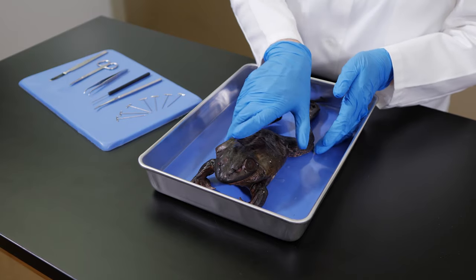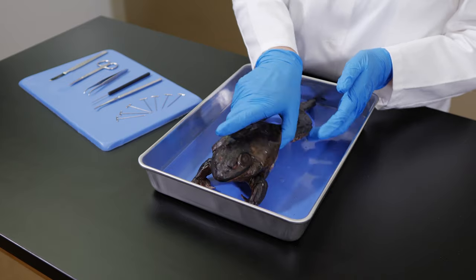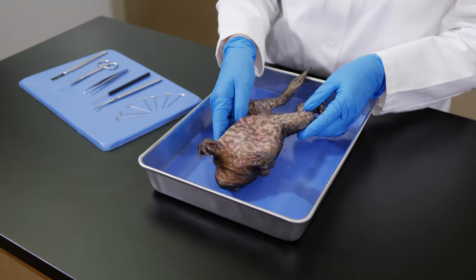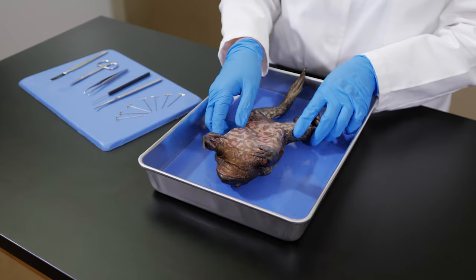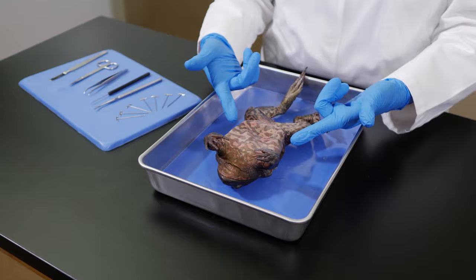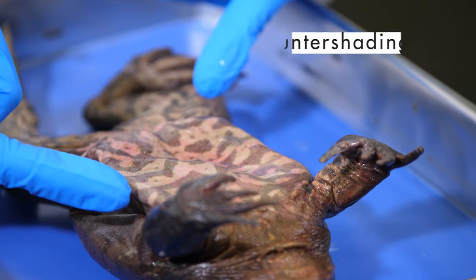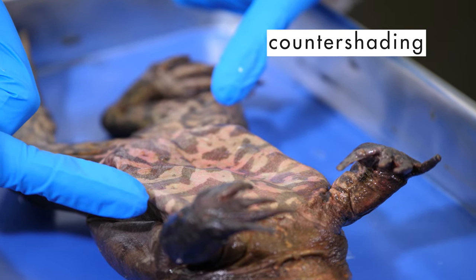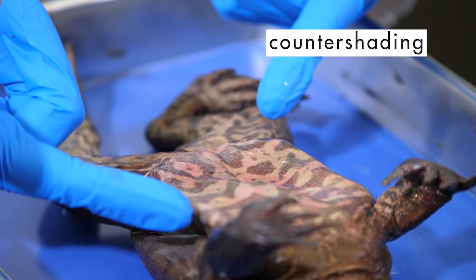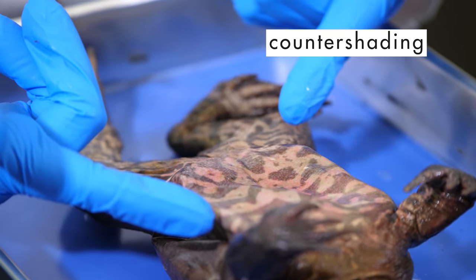Its skin is darker on its dorsal side than on its ventral side. This is an example of countershading, which is a form of camouflage we will learn about in biology.